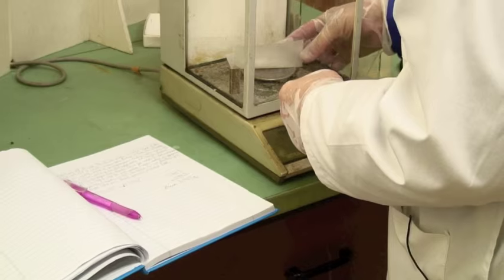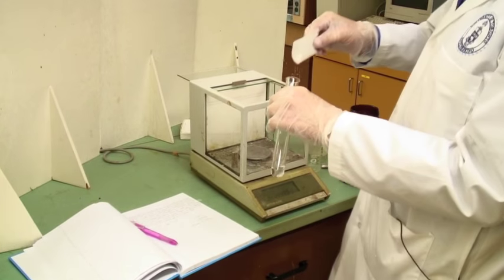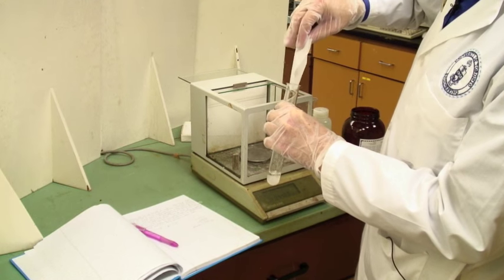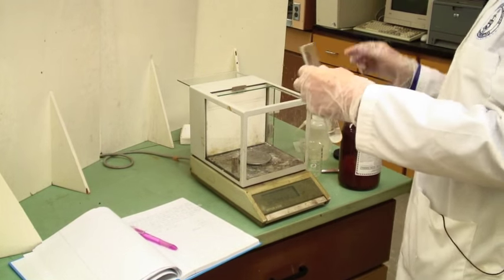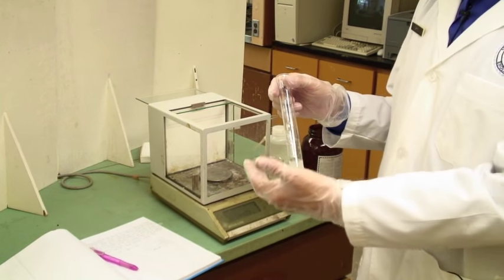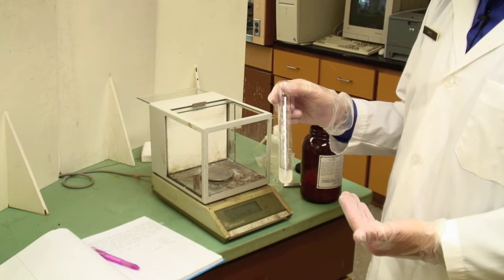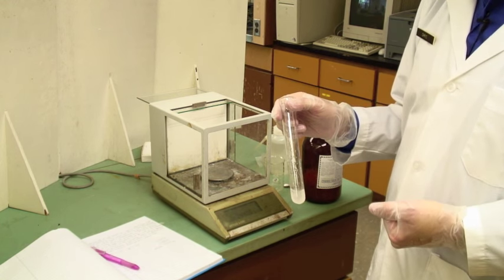And this solid we dispense into the test tube like that. And this is now ready to mix. Now you will make a series of these with different proportions of phenol to water and test them. Let's go and do the testing now.